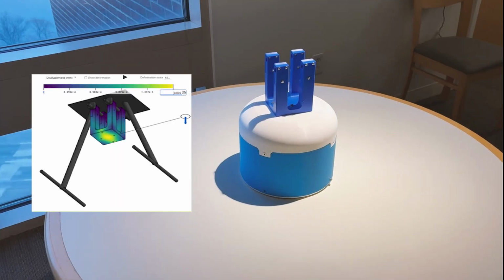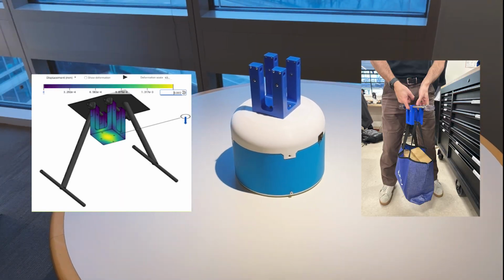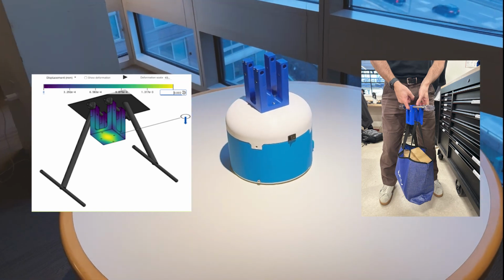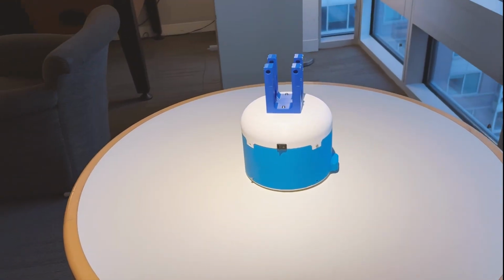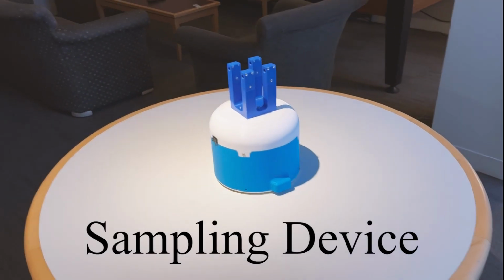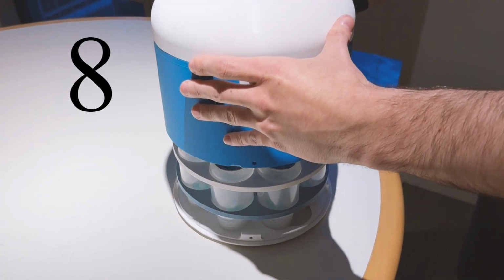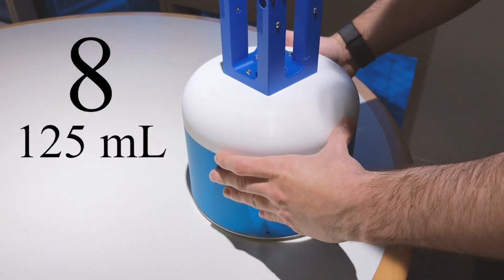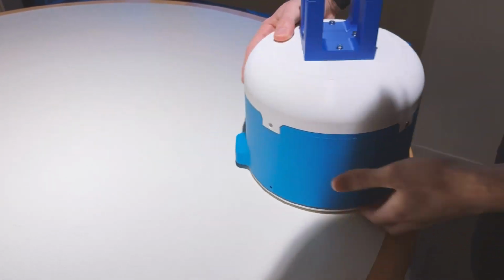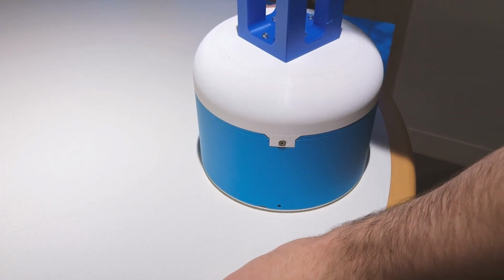The current mount has been designed to be strong enough to withstand all reasonable static and dynamic forces expected during somewhat turbulent flight. Therefore, this device works independently of the drone. HydroFetch is made up of a sampling device and a remote controller. The sampling device collects up to 8 125 milliliter samples per flight, allowing for sampling of multiple locations or repeated samples at the same location, or the combination of the two.